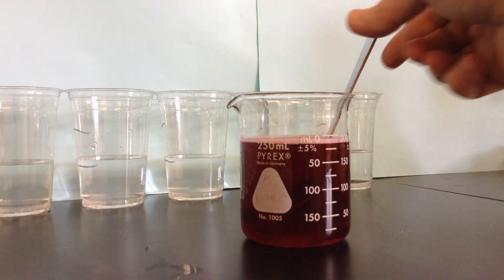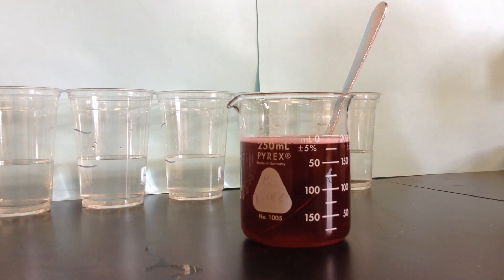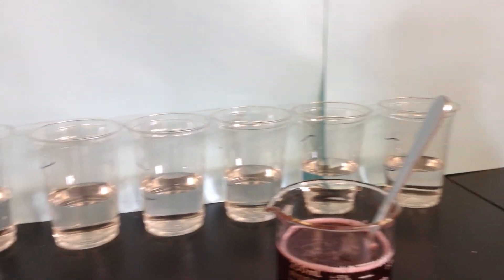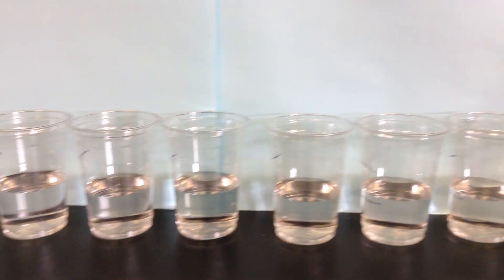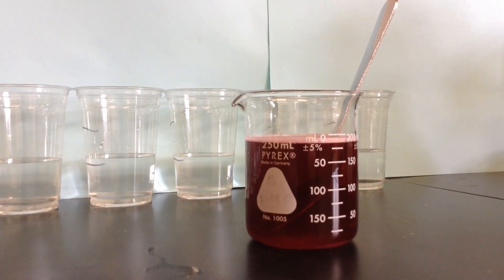So I've made a saturated solution, and I'm going to dilute it by adding more and more solvent to it — more and more water. I'm going to dilute it half and half all the way down the line, and I'll show you how that's done.